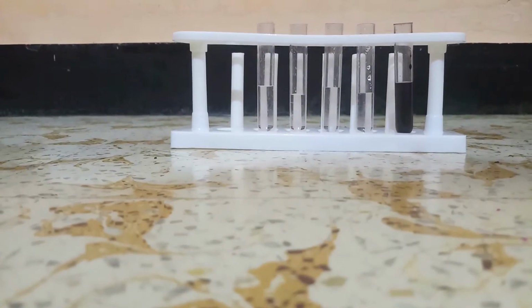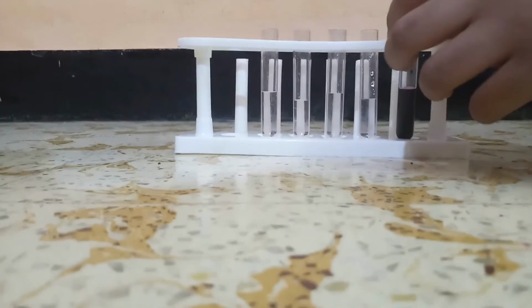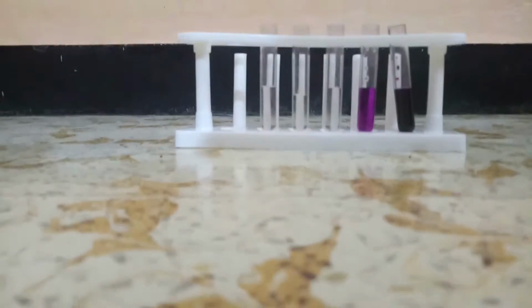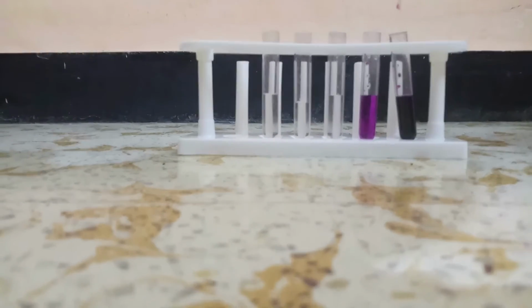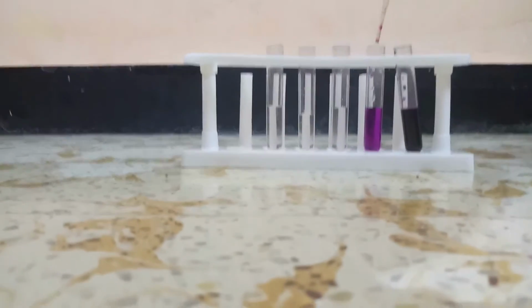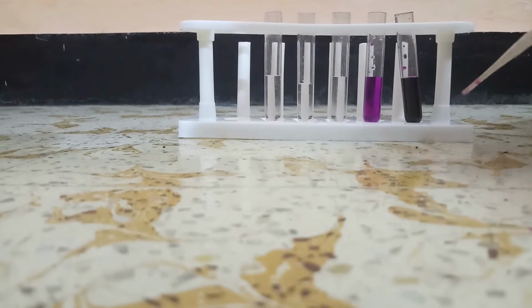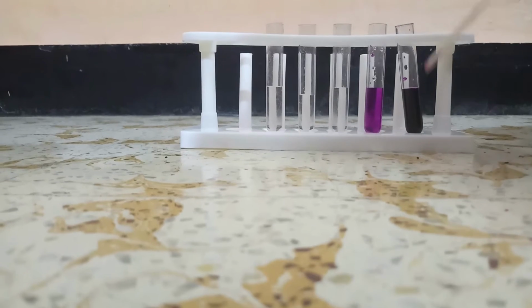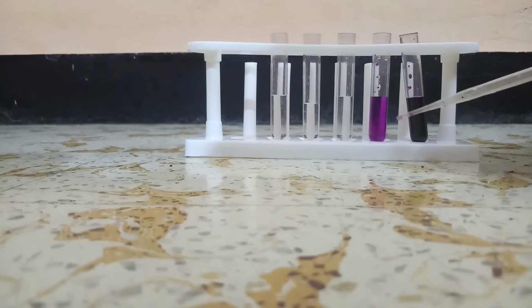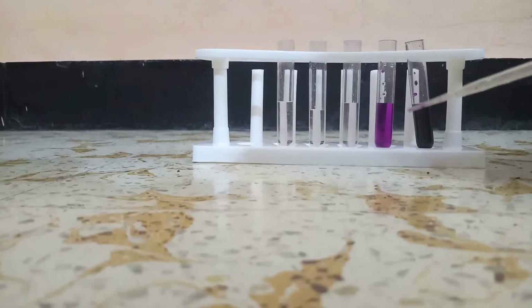The next step is to take some drops from this test tube and add it in this test tube. So now if you see, we have taken some part from the first test tube and added it to the second test tube. You can clearly see that the second test tube color is lighter than the first test tube because we have only added part of this color to the second test tube. Here also these particles get dissolved in the free spaces of the water, so we cannot see the particles after they are dissolved in the water.